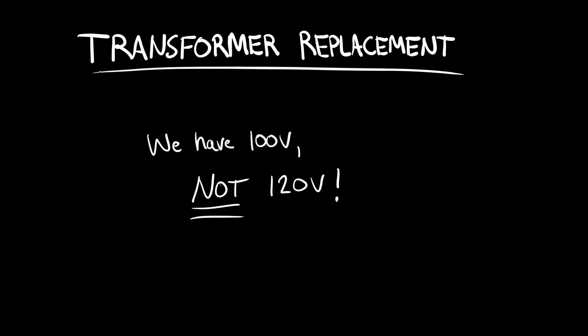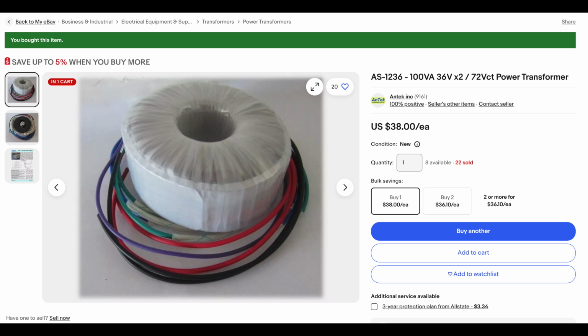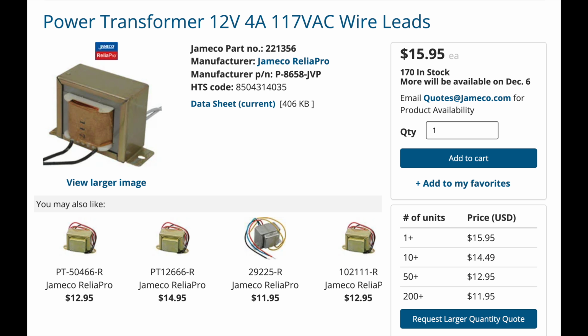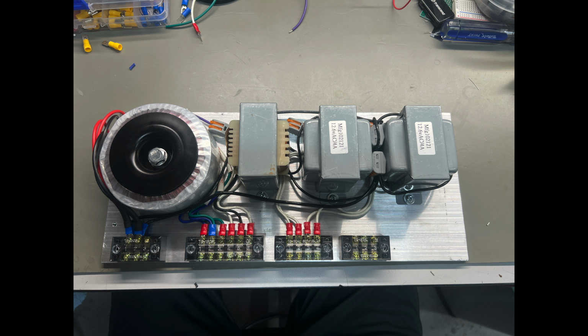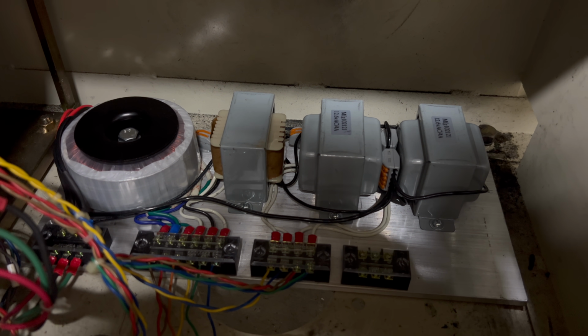There was one hiccup though. Remember that this is a 100 volt machine and most transformers are rated for 120 volts. This complicates the process of sourcing replacements, because a 120 to 12 volt transformer becomes a 100 to 10 volt transformer instead. I had to account for that. For my 60 volt power supply, for example, I used this large 72 volt toroidal transformer. For my 12 volt power supply, I used a 12 volt transformer. This only outputs 10 volts, but that's acceptable because it feeds into a linear voltage regulator that's tolerant to a lower input voltage. I mounted the transformers to an aluminum plate and found a place for them in the cabinet next to T2. I checked each output to make sure it was correct, and then wired it in.